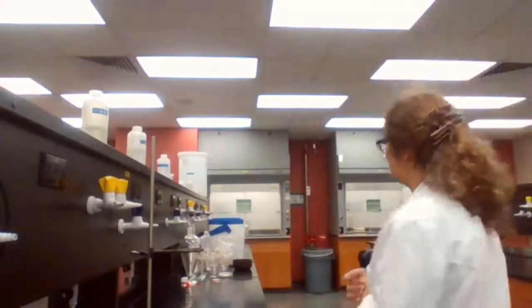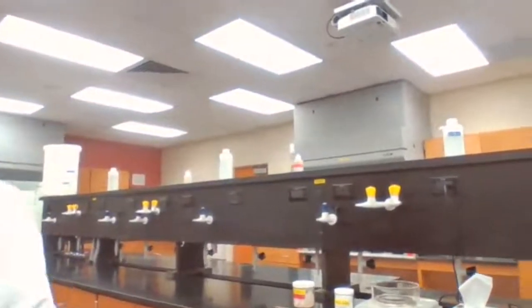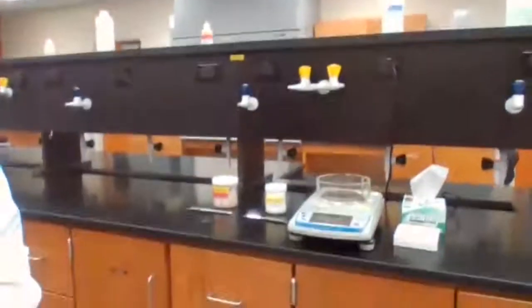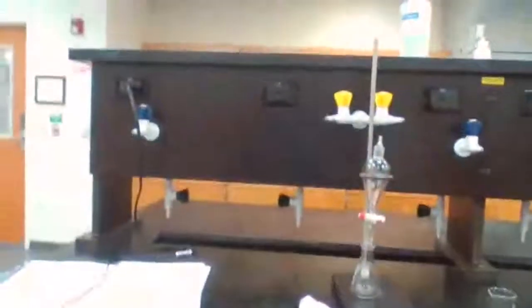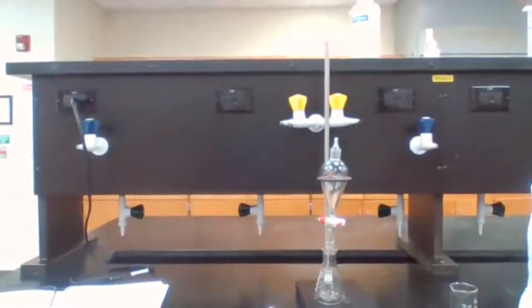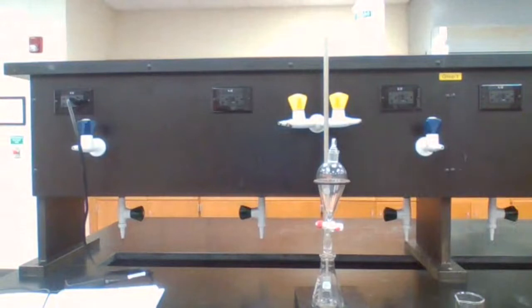Okay, I'm going to measure 1 gram of the mixture, and with the 1 gram of the mixture that I'm going to measure here, I'm using the scale, and I want you to take a screenshot. So let's have a screenshot of it, right here, not moving. Take a screenshot of that.